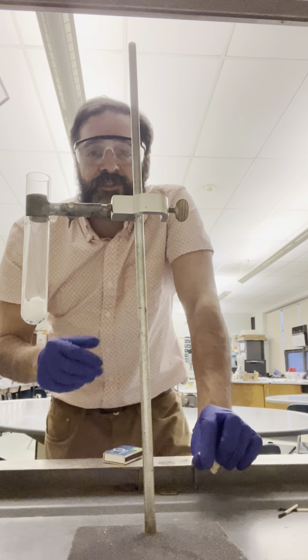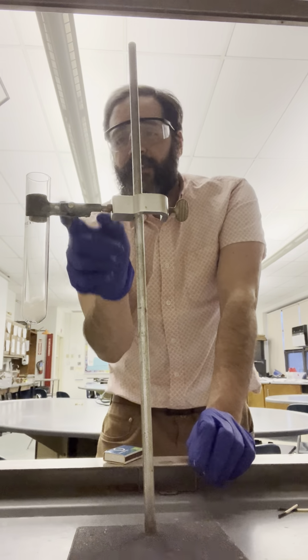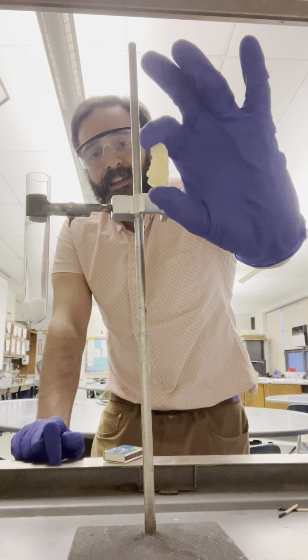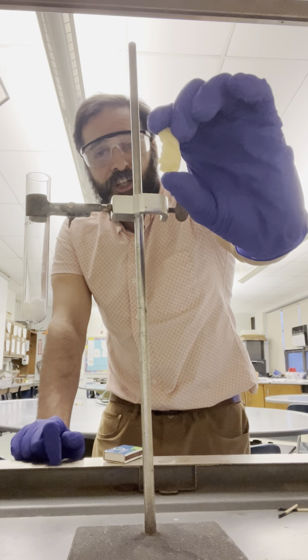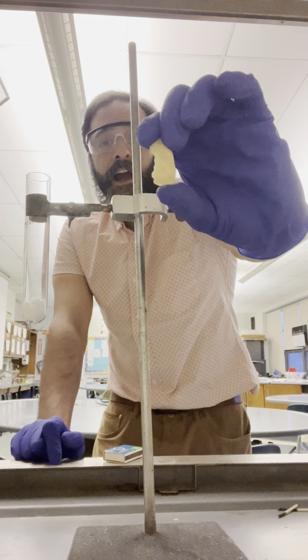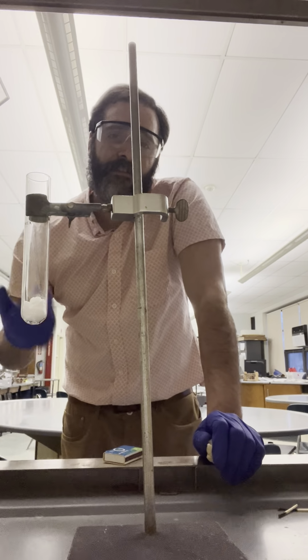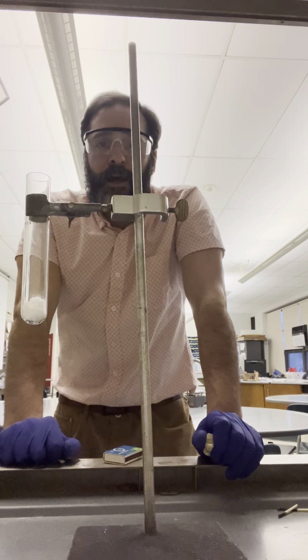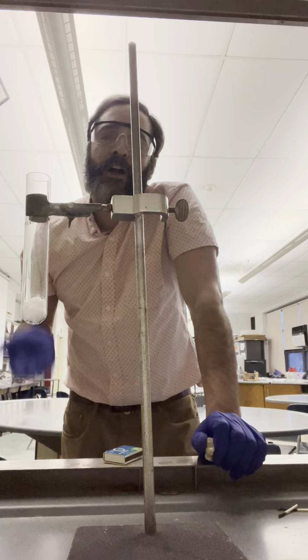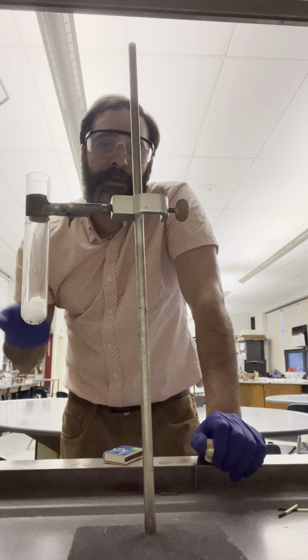What we're going to notice once we decompose the potassium chlorate and the tube is filled with hot oxygen is all I need to do is drop this, it's not a gummy bear, the pineapple chunk, into the test tube, and it is going to go haywire. This shows us a couple of things. In our environment, we live on a planet that has about 20% oxygen in the air. If the percentage of oxygen was much higher than that, humans would not be able to live. Animals would not be able to live.